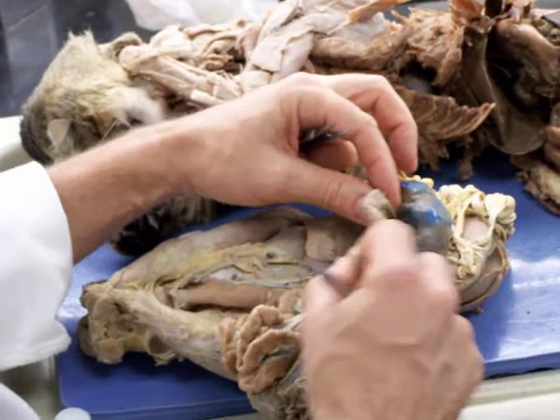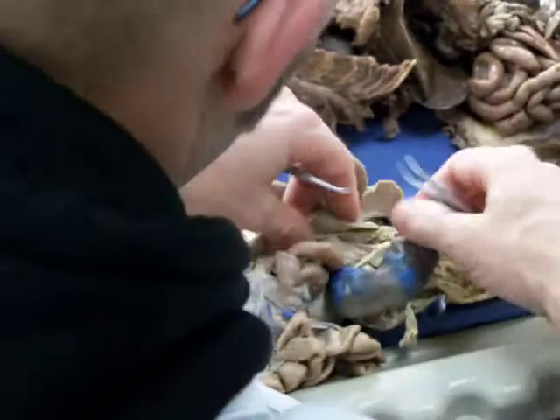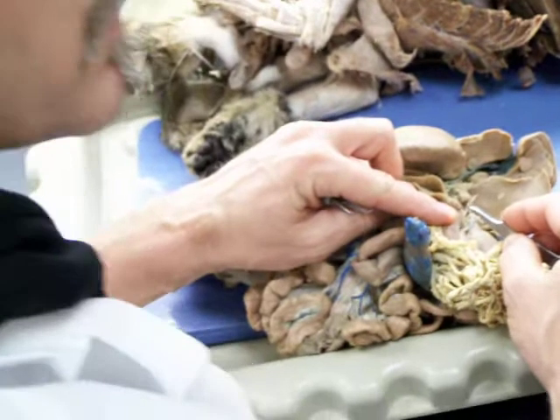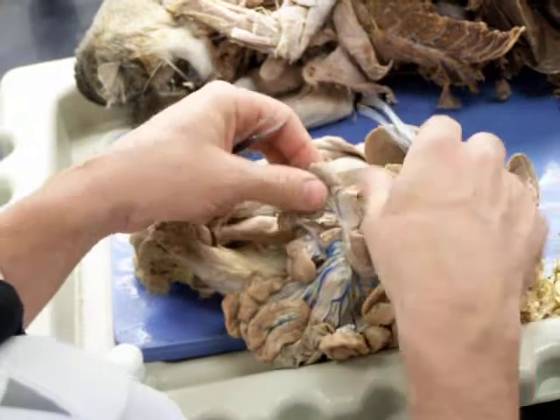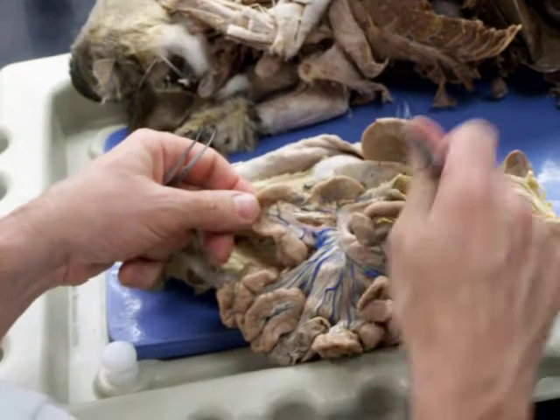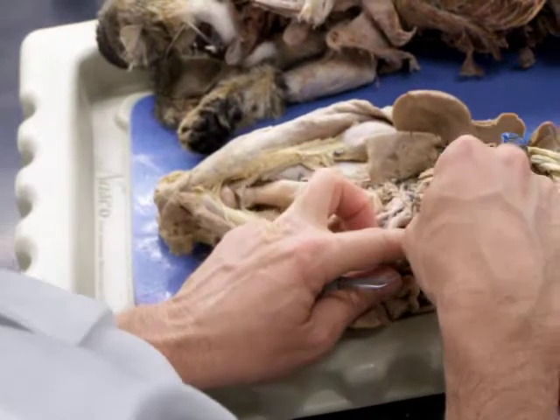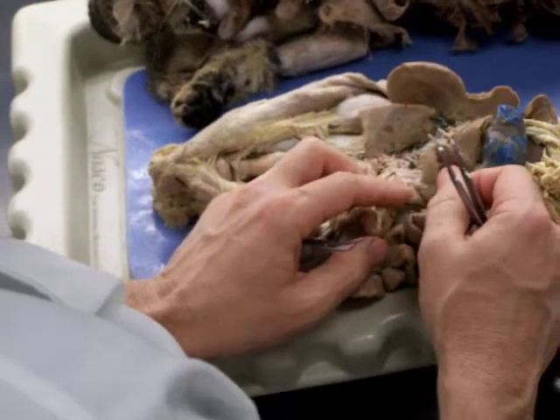Can you point out the duodenum again? Well, the duodenum's cut open here. That's this part right here. And the distinction's not real clear at the caudal end, but cranially it starts at the pylorus. Okay. The pyloric sphincter will be right in here, and so this is small intestine. Continuing down here, usually about to where it starts to curve back up. That's usually how it's defined. And so this would all be duodenum. And so this right here is the caudal pancreaticoduodenal, going up into the duodenum.